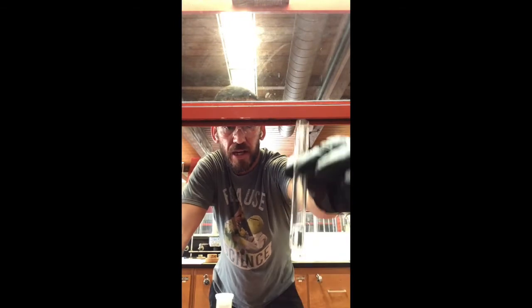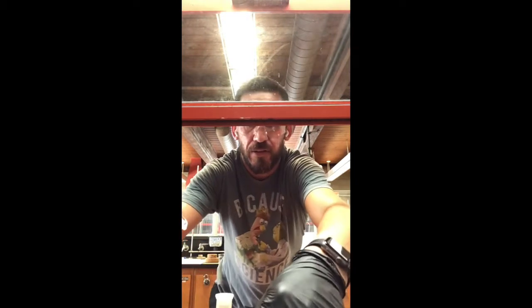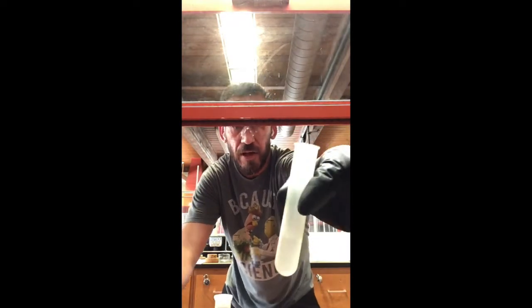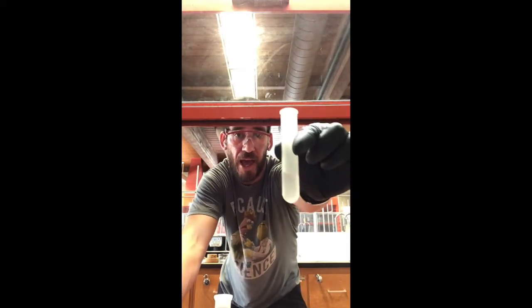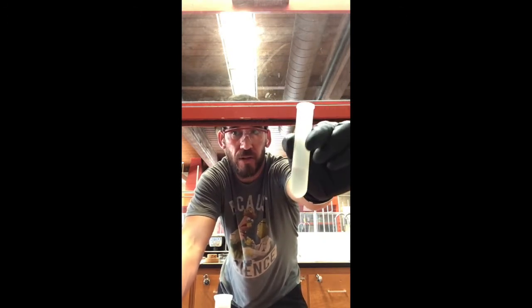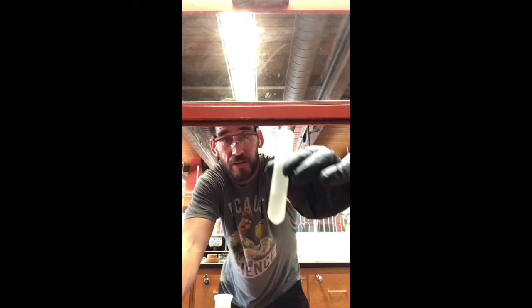All right, so now since we've got our first extraction taken care of, we've got the methylene chloride and the 2 mils in there. We're going to go ahead and add another 2 mils to our original centrifuge tube. Okay, so this is the centrifuge tube that had 2 mils of methylene chloride with the 4 mils of water and the 0.07, or I weighed out about 0.08 grams of caffeine, right?